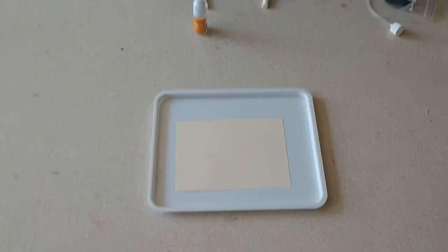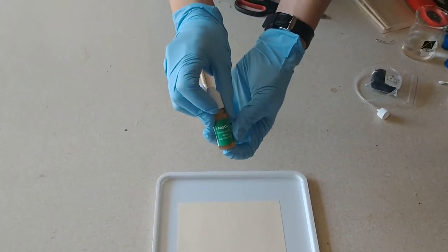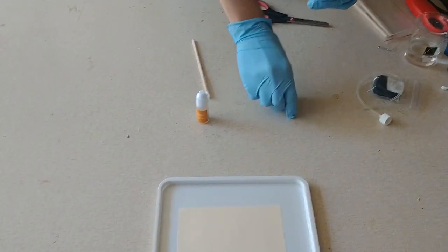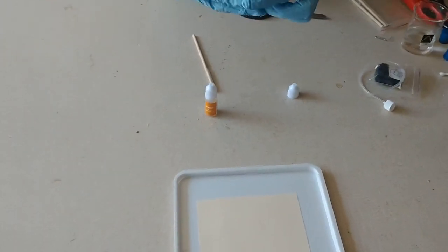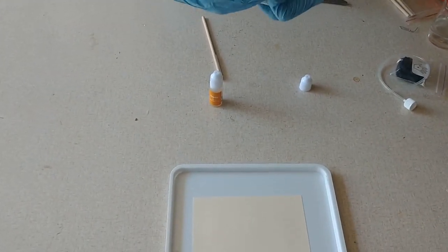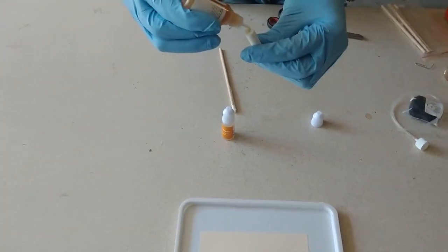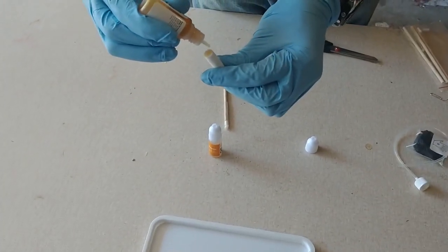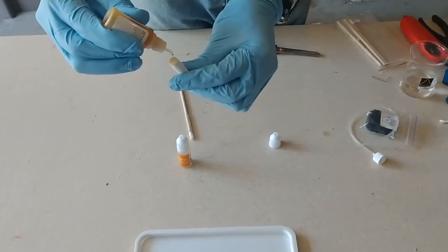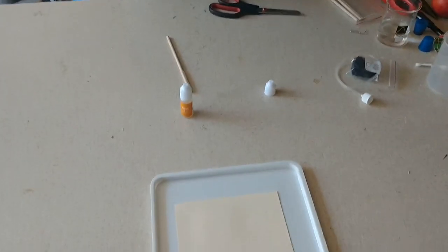Next thing I'm going to do I've got iron sulfate. I'm going to put five to seven drops of the iron sulfate onto another cotton swab here. Four, five, six, seven. There we go.